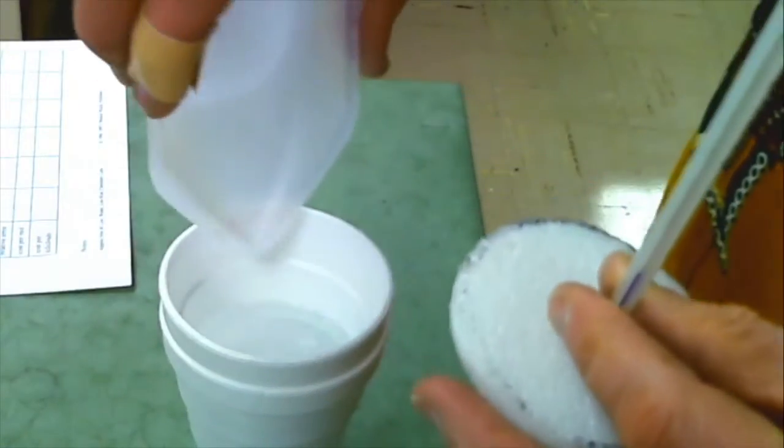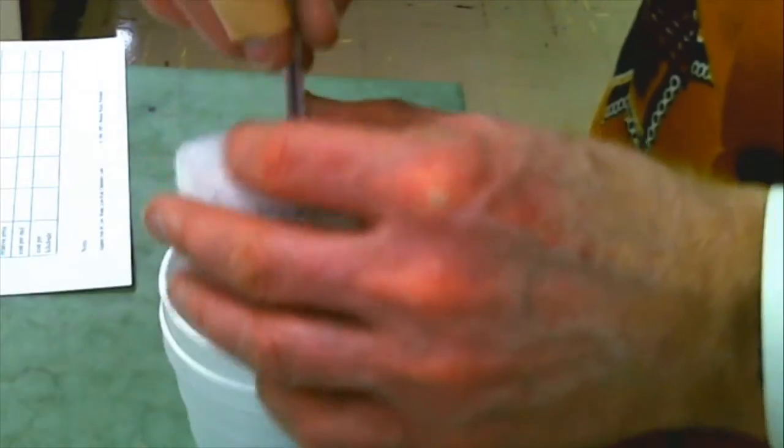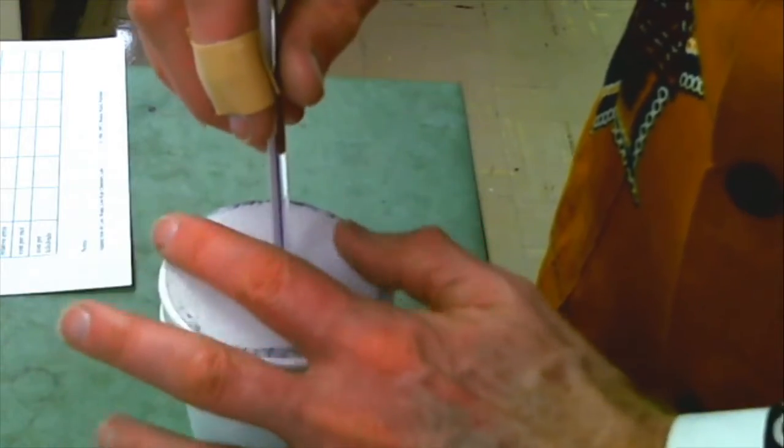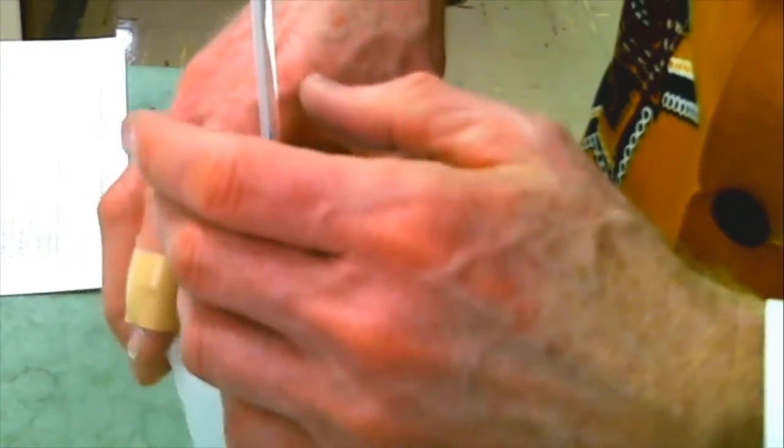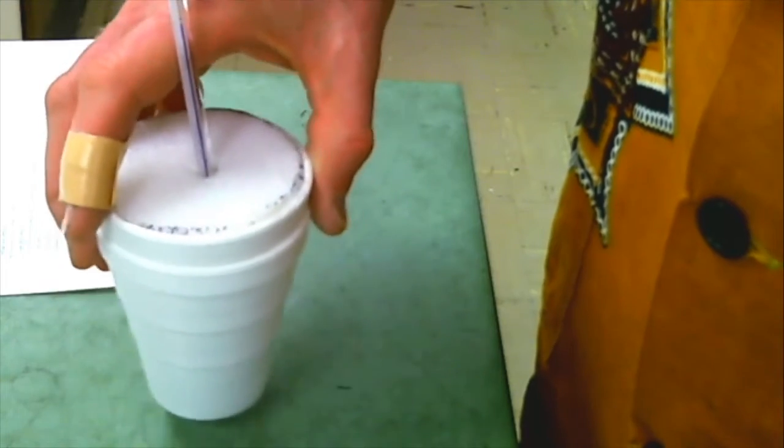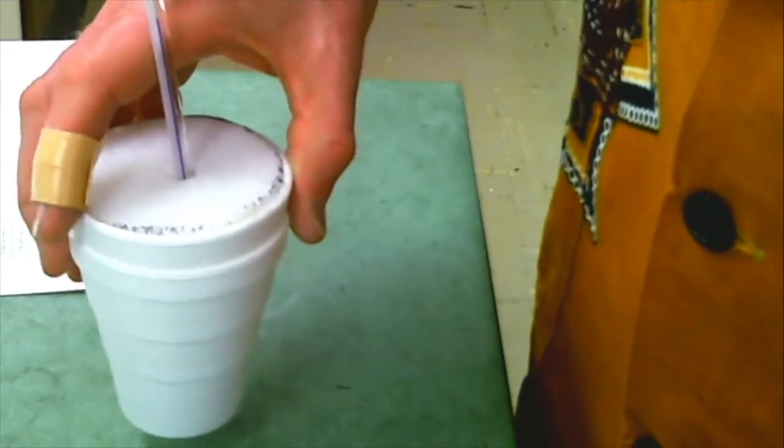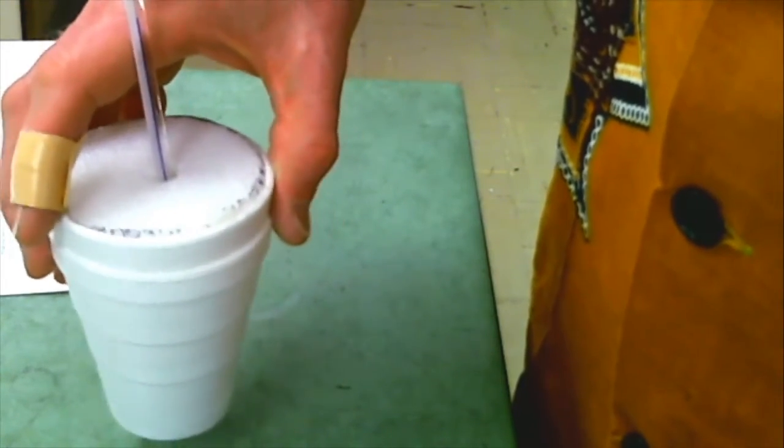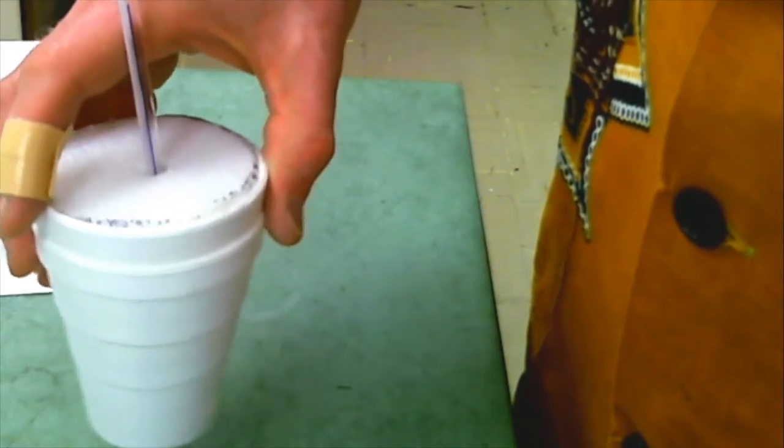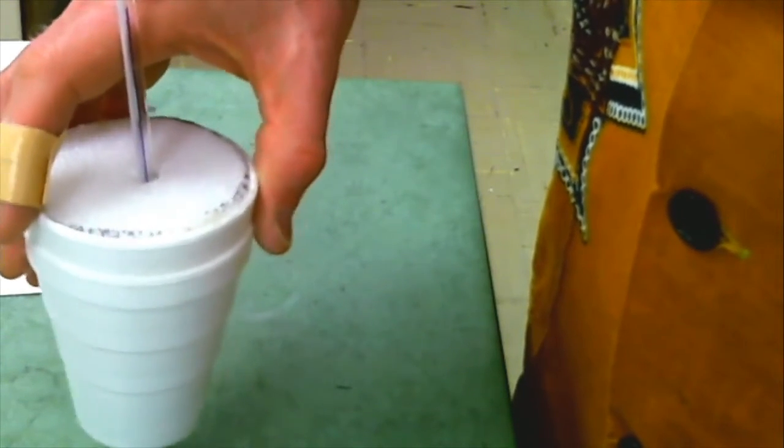Add the lye. So with this solid, I'm hearing the pellets of the lye tapping against the glass of the thermometer.